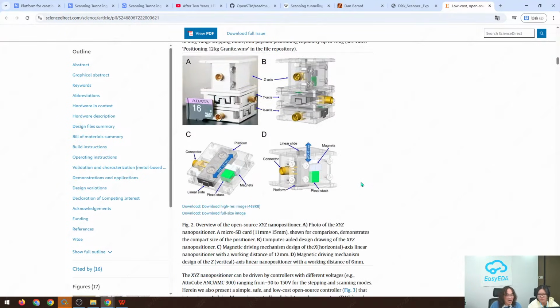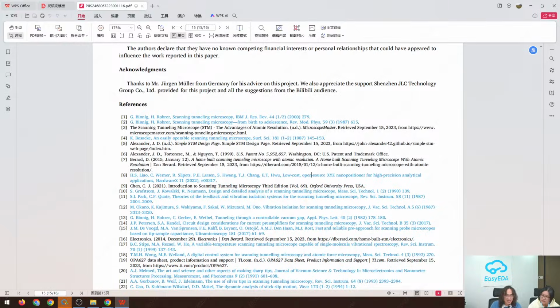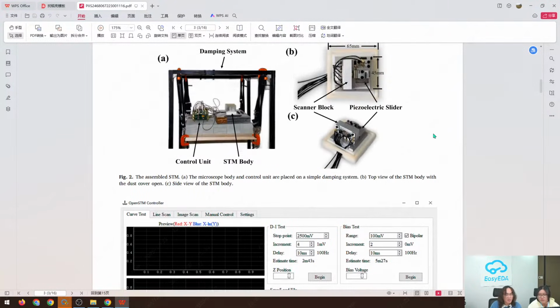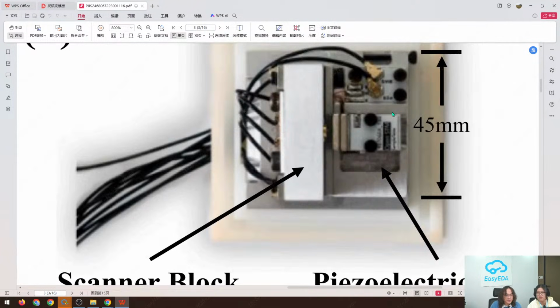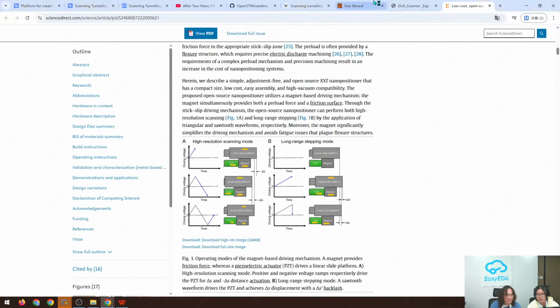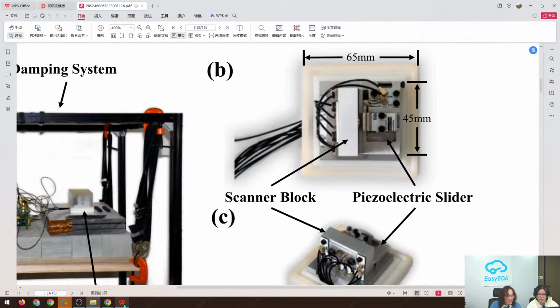So this is how, inspired by this project, I used his piezo positioner in my project, and we can see the structure of my STM. Here is the scanner, so-called, and it is the piezo buzzer here, just like Dan's design, exactly the same one from here. And we got a piezo slider, a low cost XYZ positioner here.